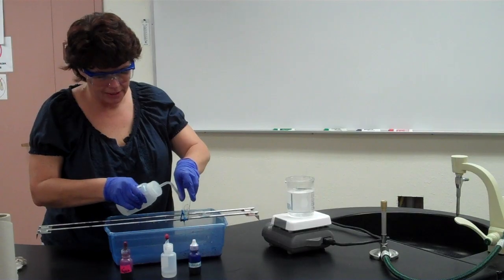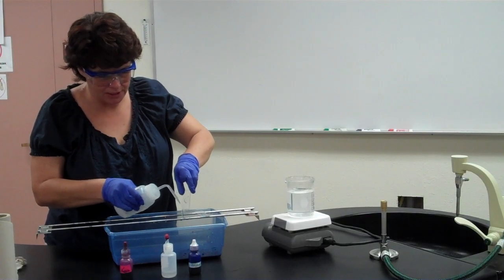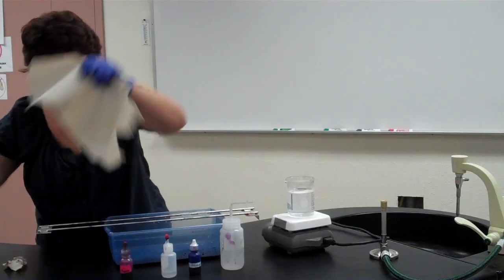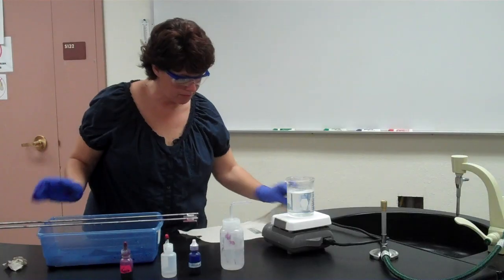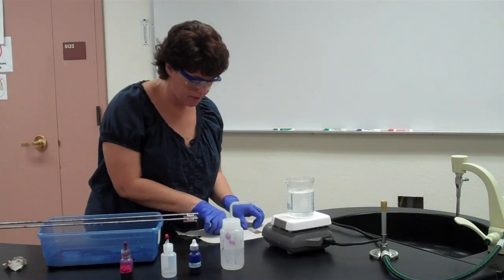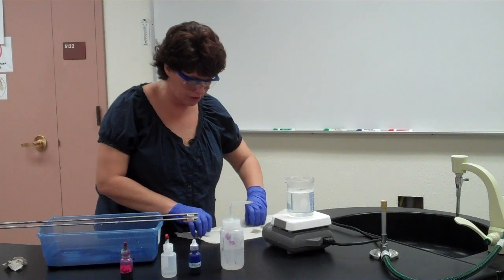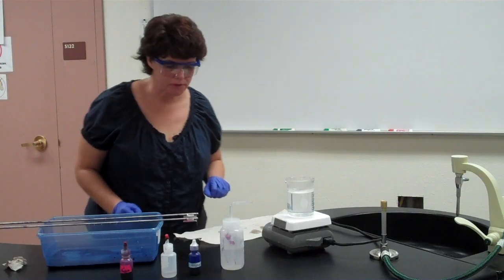When you've seen slides that have too much stain left on them, you end up with big blotches of stain. Remember, that's not bacteria, okay? So we've rinsed them, now we can blot them dry as we did in other procedures, okay? So remember, you want to gently blot with a paper towel. Don't rub, because you don't want to rub off the smear that you just spent 45 minutes on, or however long it takes you. Okay? We'll let those air dry completely before we look at them under the microscope.